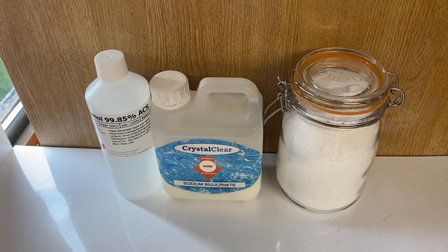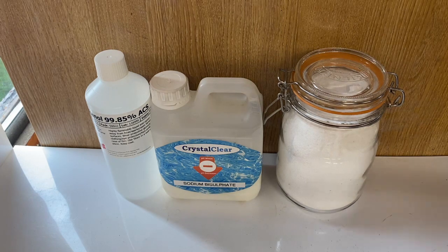The purity of the borax doesn't really matter that much as we will be distilling the trimethyl borate afterwards anyway. I don't really have much use for this trimethyl borate other than burning it. I think the green flame looks quite cool and I'm going to put it inside my Halloween pumpkin.